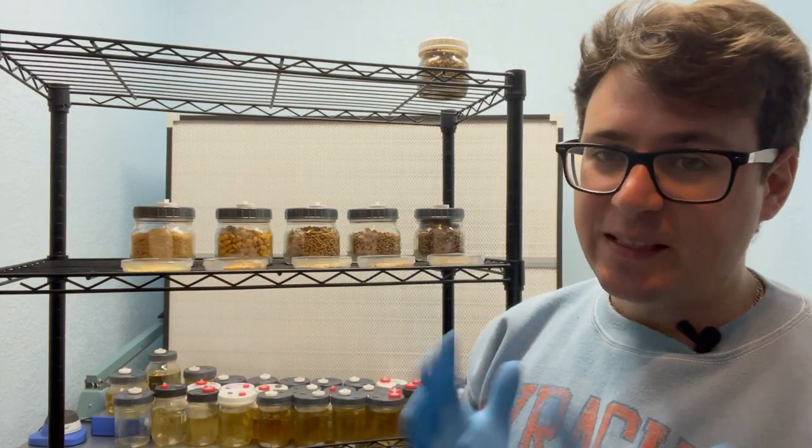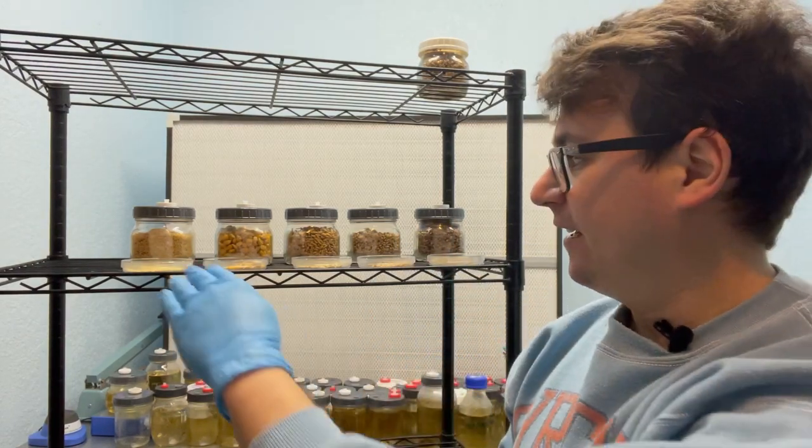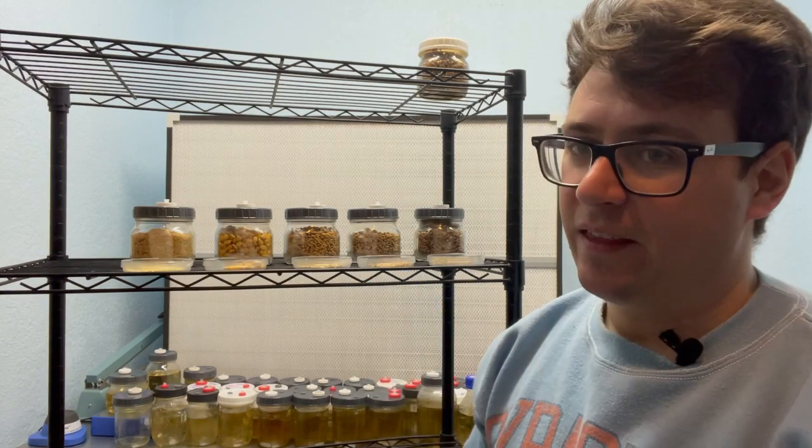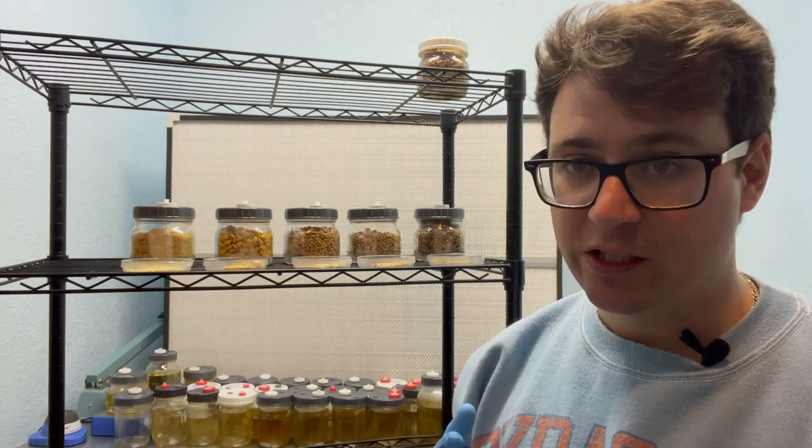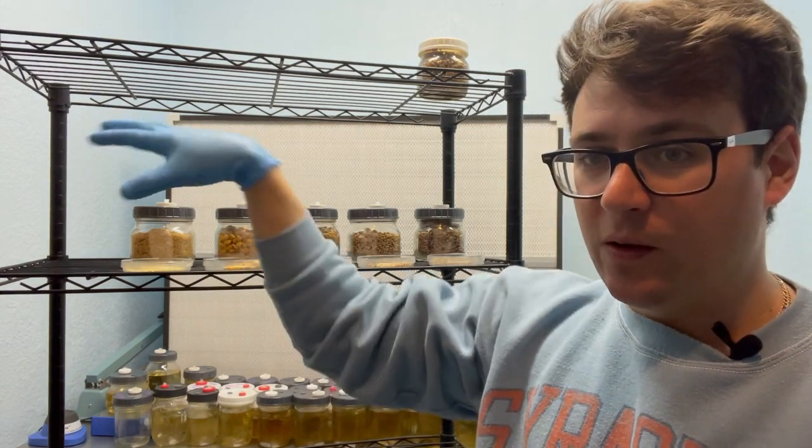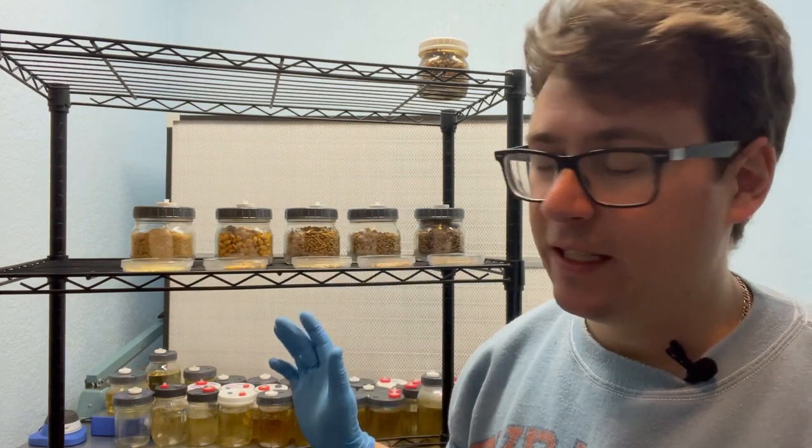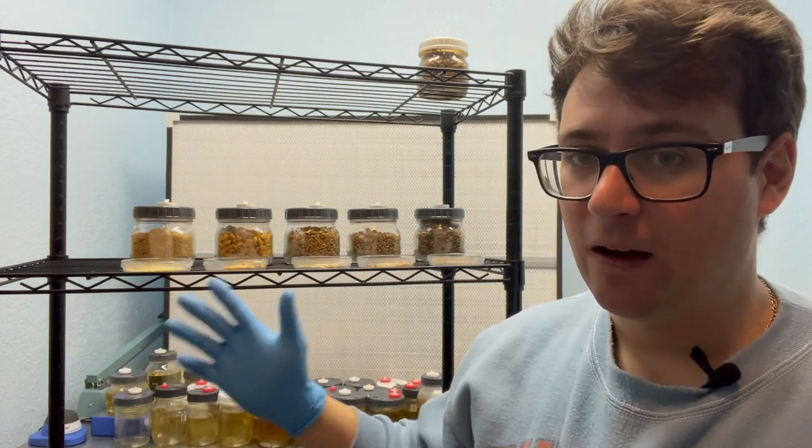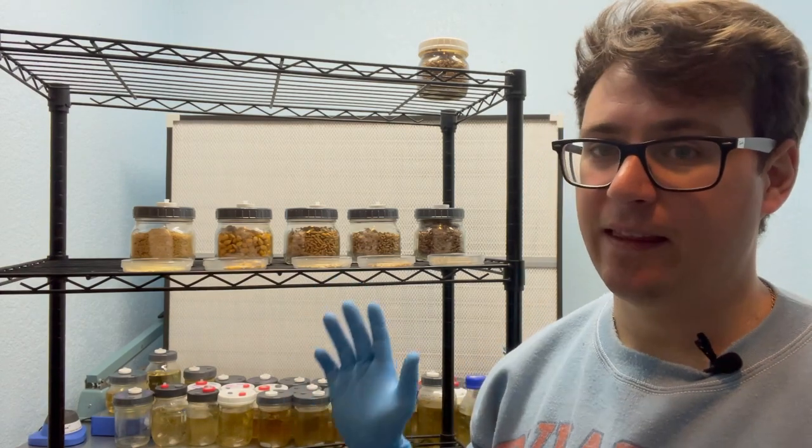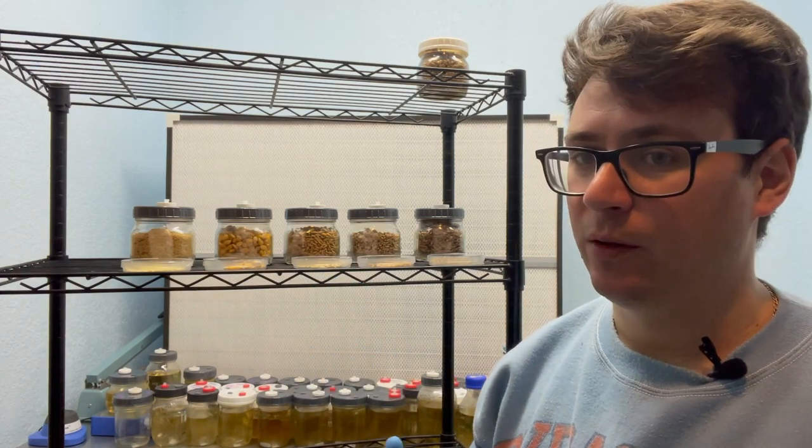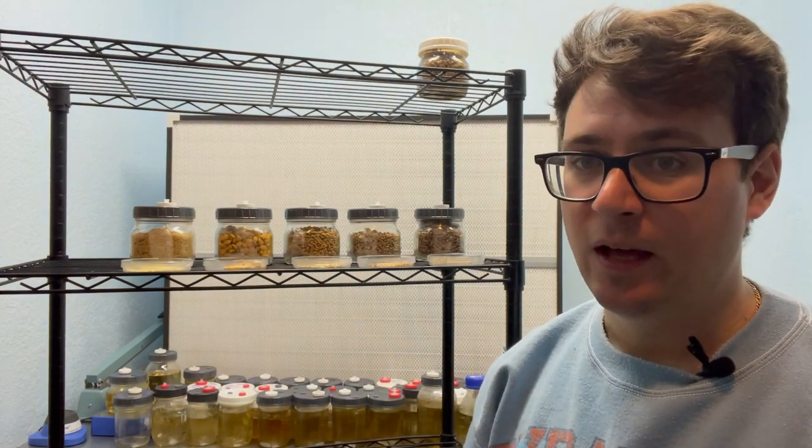It's been about seven days now since we inoculated these various grains with our Pioppino liquid culture. I wanted to show you guys the updates after one week and I'm actually going to shake all of these grains so that they will be available for my production cycle next week.